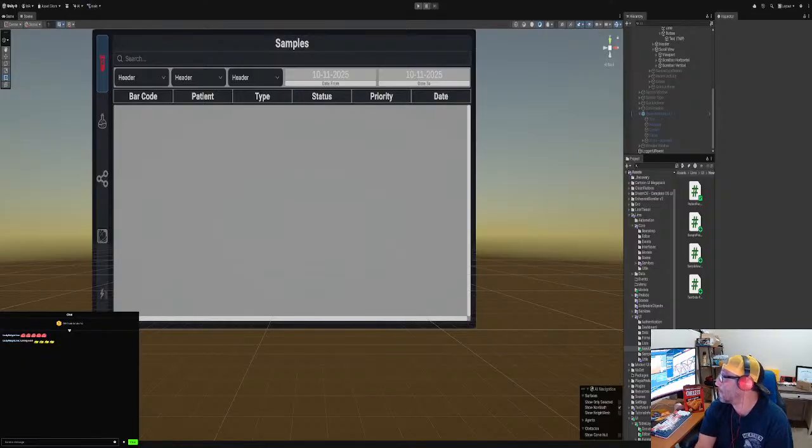Let's get to it. Last time we had a problem with our list, so we couldn't get it right. So what we did was we used a plugin called Table Layout. Let me see if I can get it up on screen here. Table Layout, and then we also used Enhance Scroller, and then we mixed the two up.